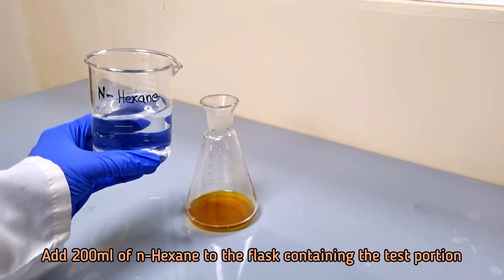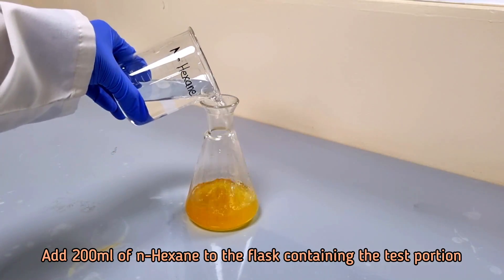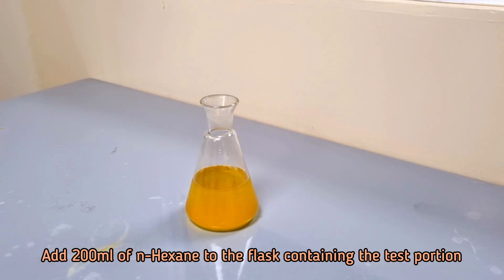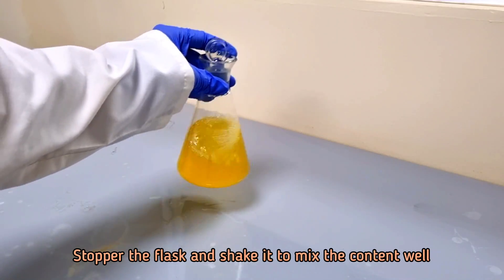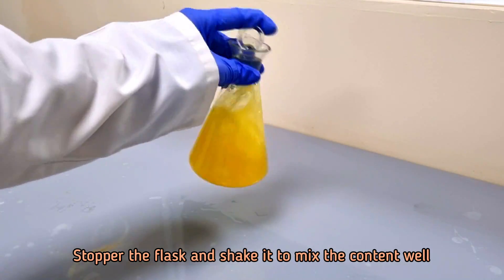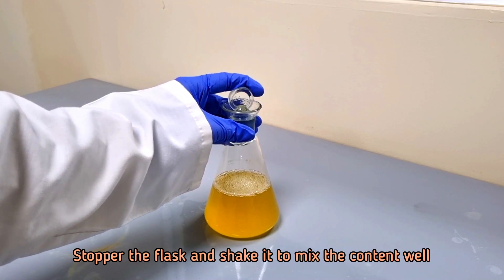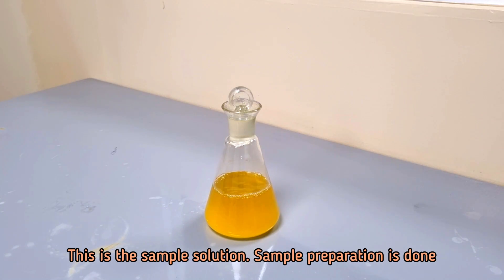Add 200 ml of hexane to the flask containing the test portion. Stopper the flask and shake it to mix the contents well. This is the sample solution. Sample preparation is done.